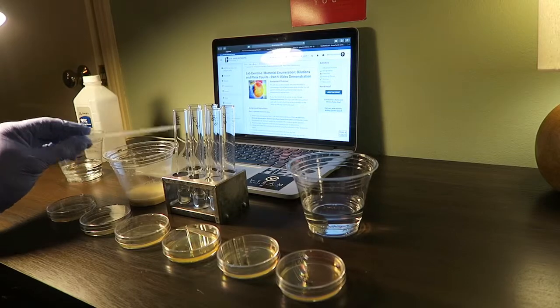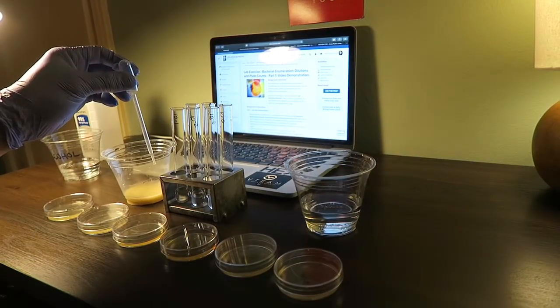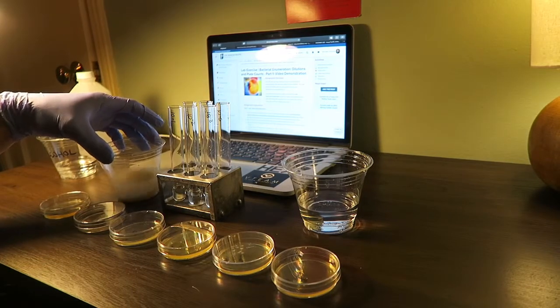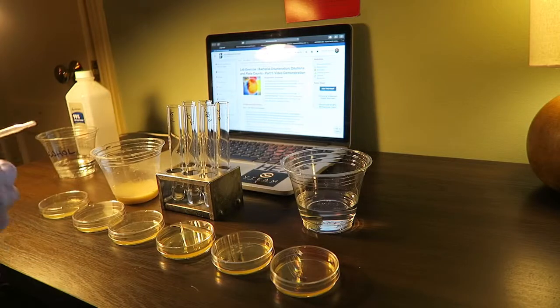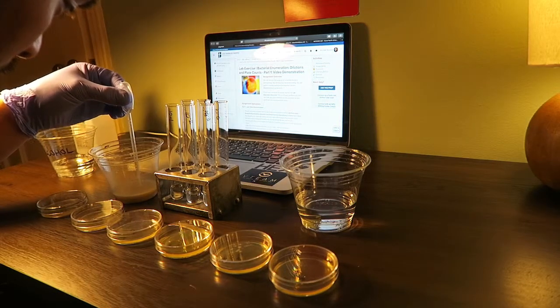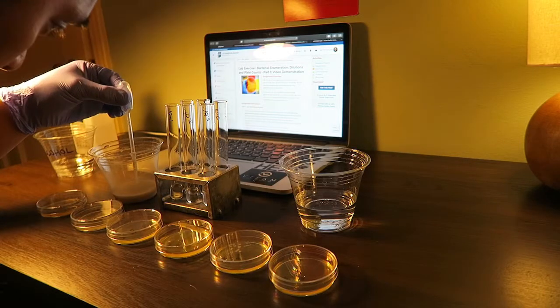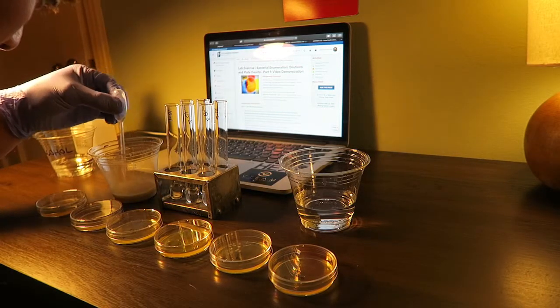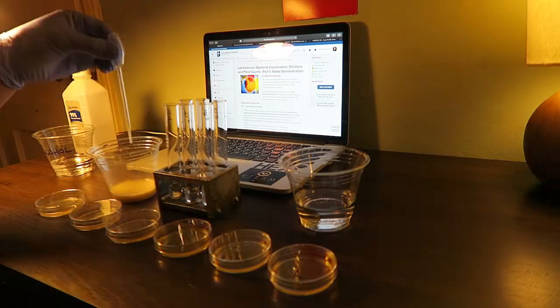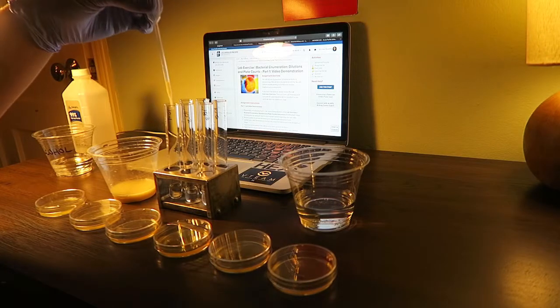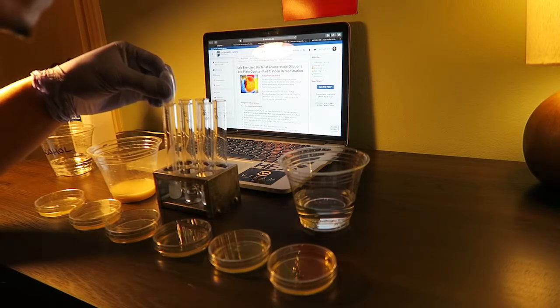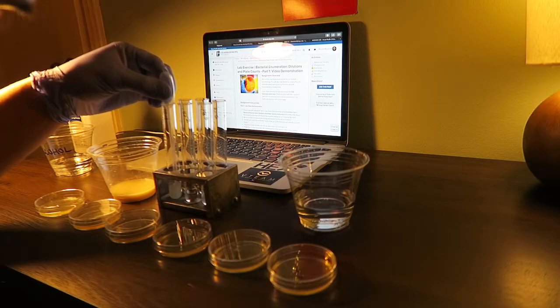I'm going to pipette 0.25 ml of the Saccharomyces cerevisiae and I'll put it into the corresponding test tube one. And then I'm going to swirl this a couple of times in test tube one.